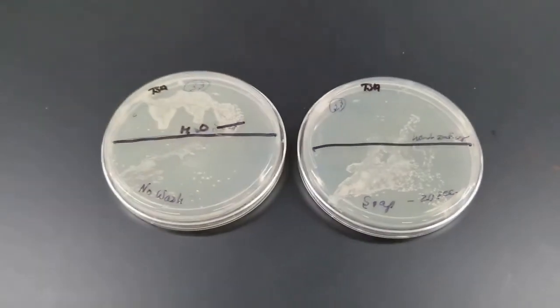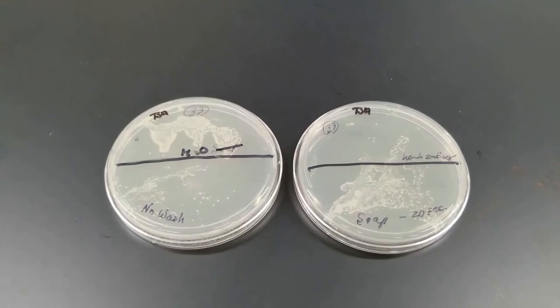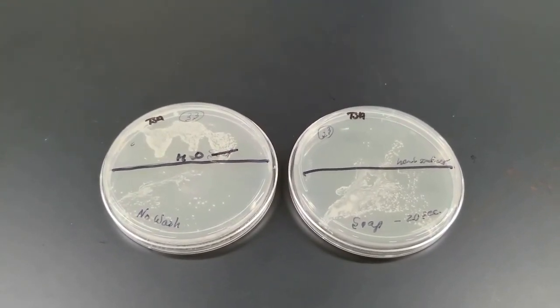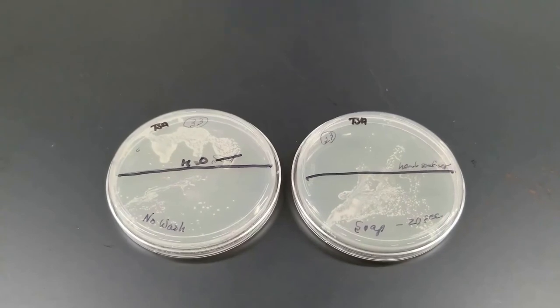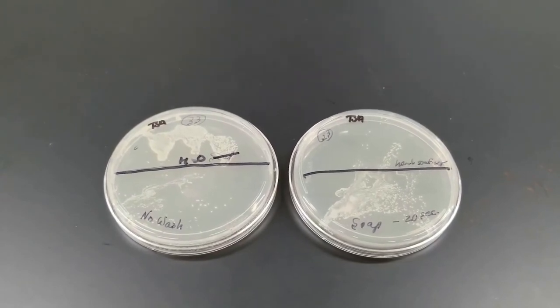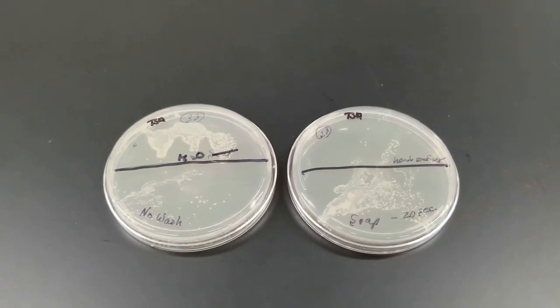I really want to stress this. We are filming this particular lab during the COVID-19 pandemic. So I want to stress to you the importance of hand washing, and also stress the importance of when you touch one substance, go touch something else. You could be transmitting those microorganisms from one location to another. So just wash your hands.